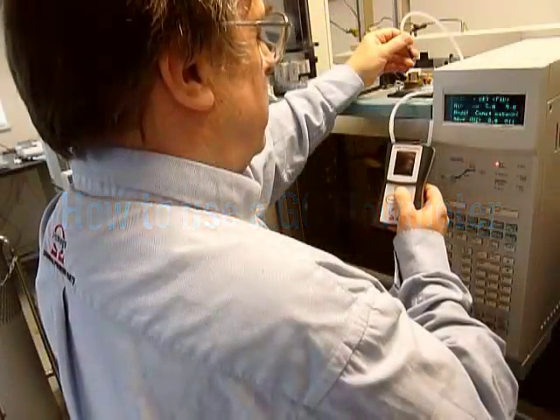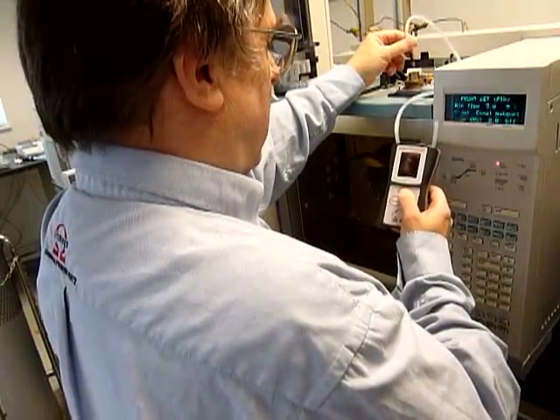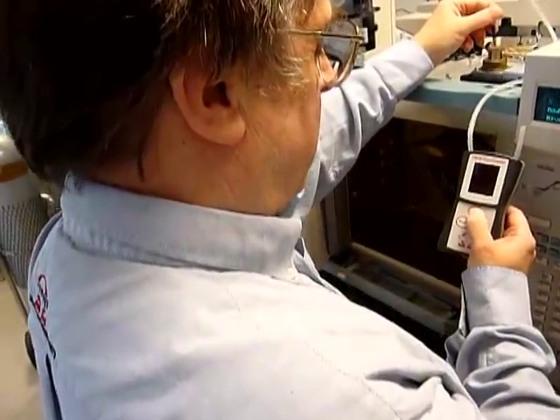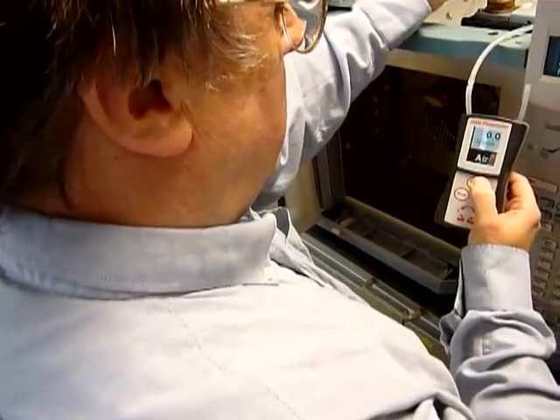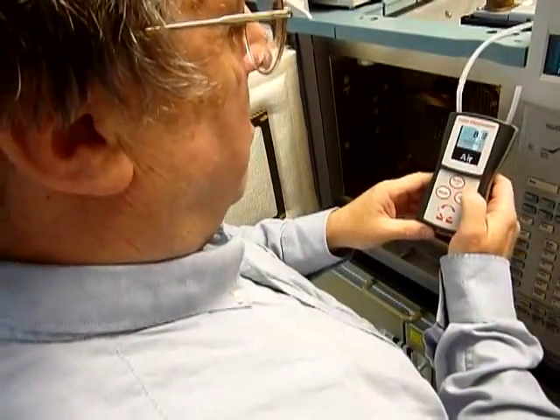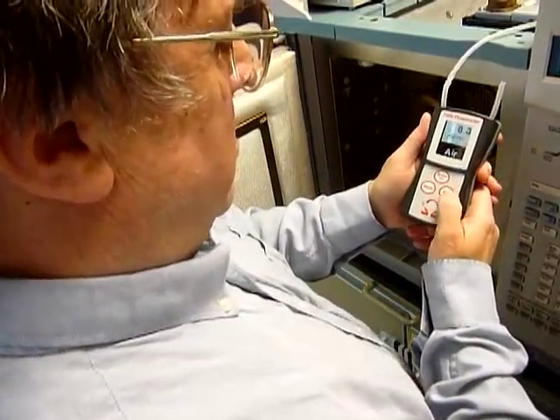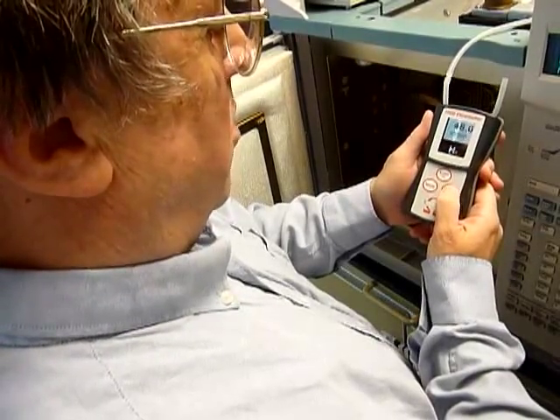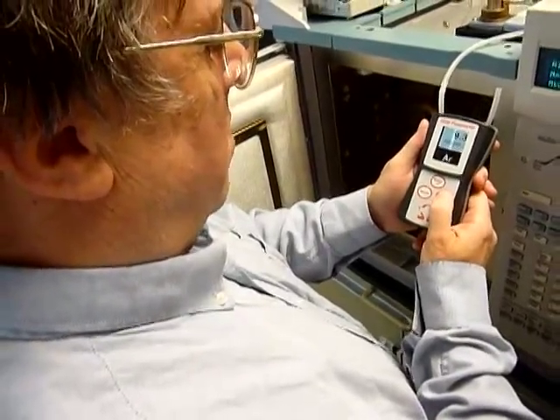Today I'm going to use this 7000 GC flow meter to measure the gas flows. To start the flow meter, press enter. The volumetric flow is given. To select the gas you're actually measuring, press the next key until the appropriate symbol is shown for the gas you are measuring.